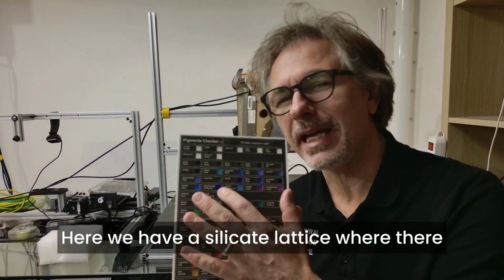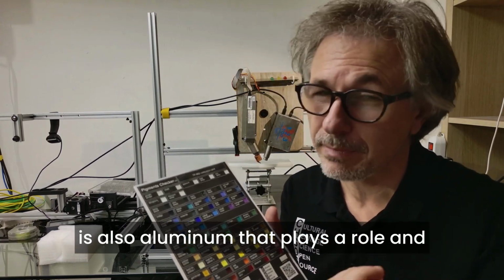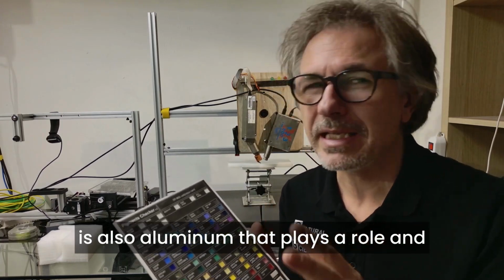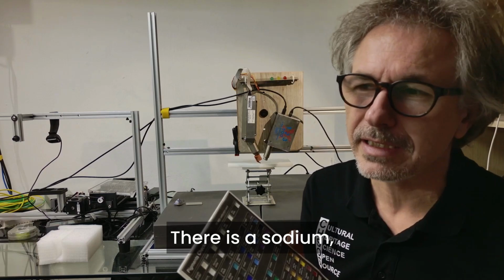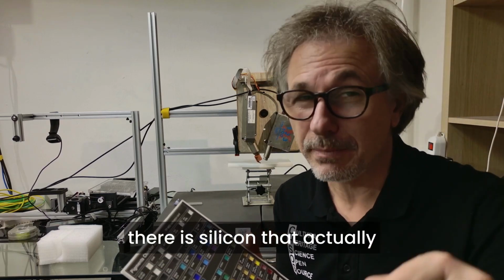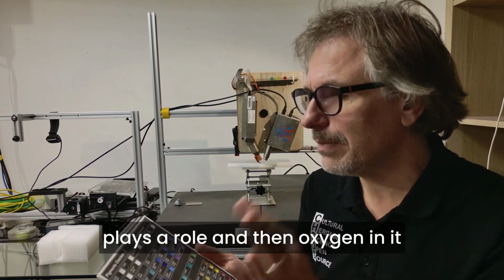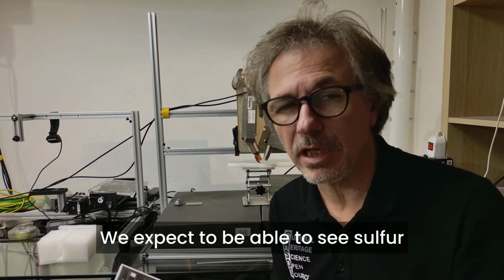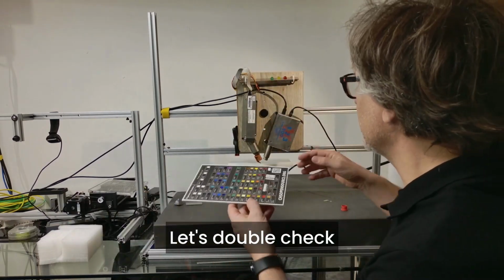Here we have a silicate lattice where there is also aluminum that plays a role, and other elements that are not important. There is sodium, there is silicon that plays a role, and then oxygen in it. We expect to be able to see sulfur, but less of it. Let's double check.